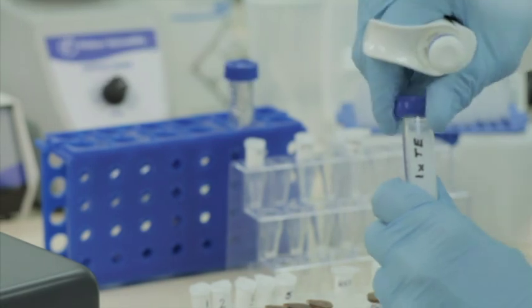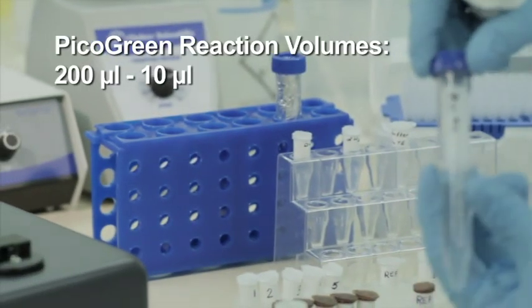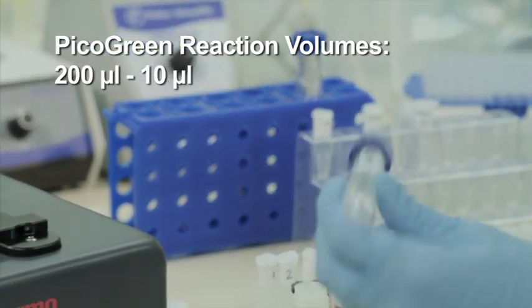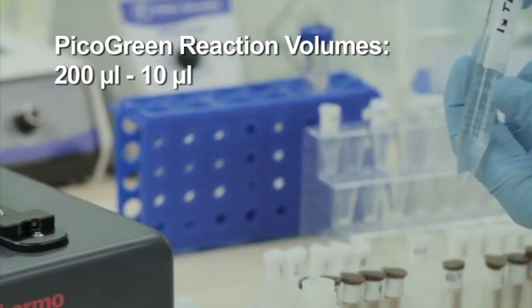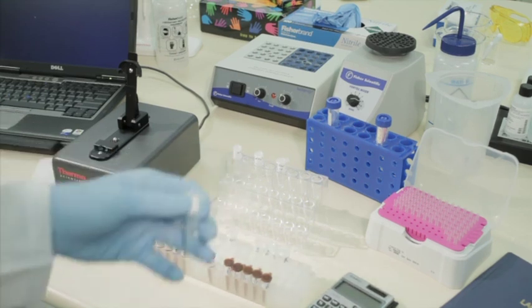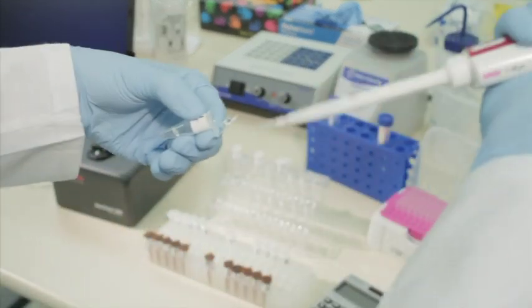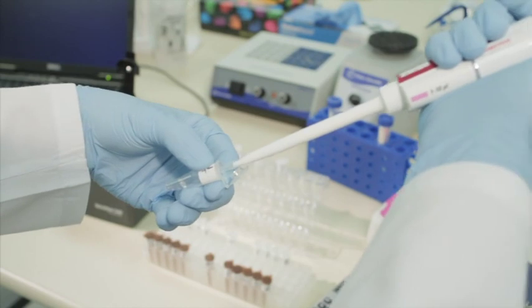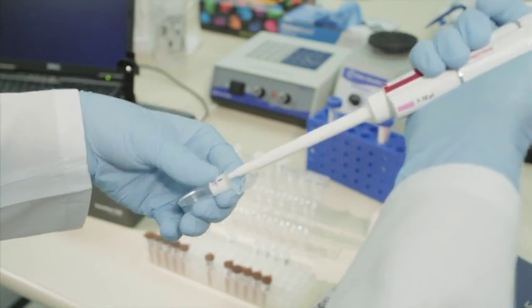Reaction volumes can range from 200 microliters to as little as 10 microliters. In this example, we will prepare 10 microliter reaction volumes. Next, prepare serially diluted double-stranded DNA standards in nuclease-free vials or tubes that will cover the expected concentration range of the unknown DNA samples.